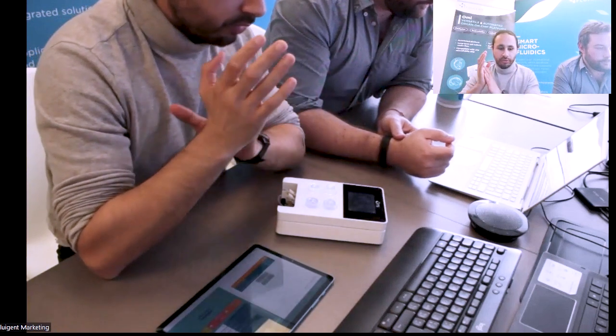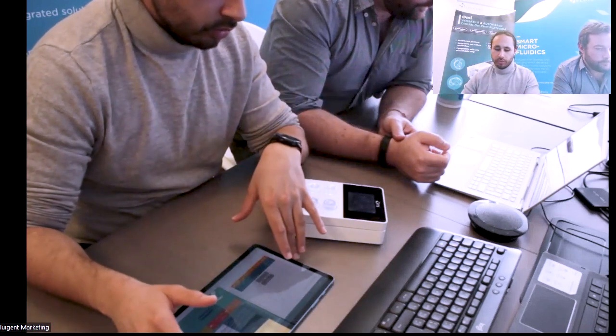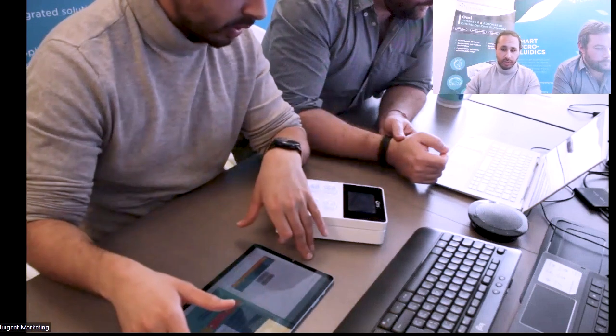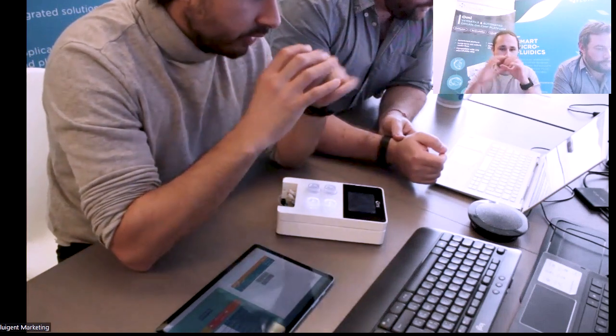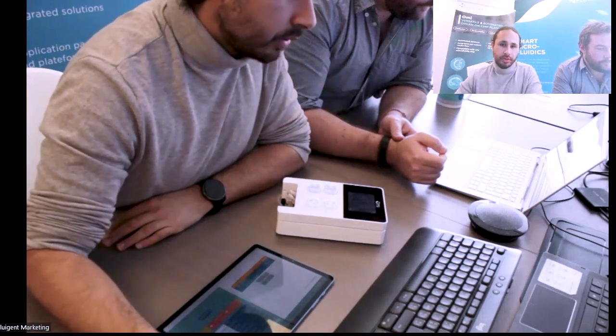We have different offers: for 1 OMI you only need 1 tablet with 1 application, and for 2 OMI, this is 1 tablet where you will synchronize the 2 together. If you have 3, if you have 6, there are different offers, but yes, 1 OMI is 1 channel with recirculation, perfusion, injection, and sampling.